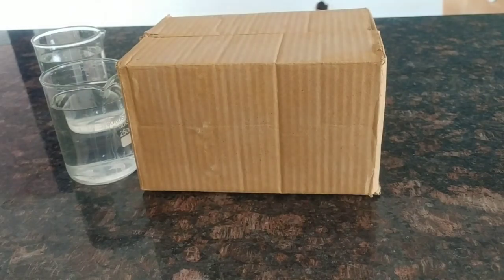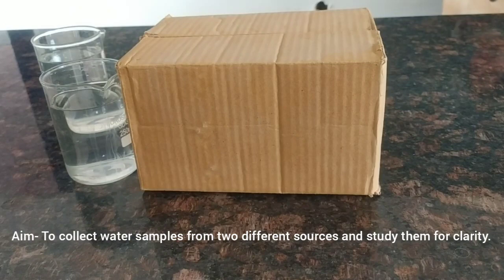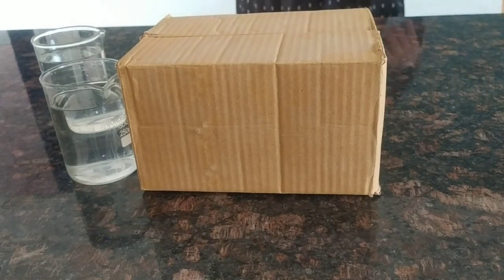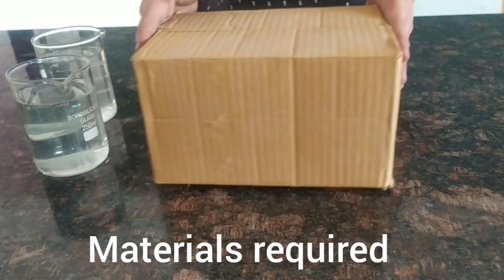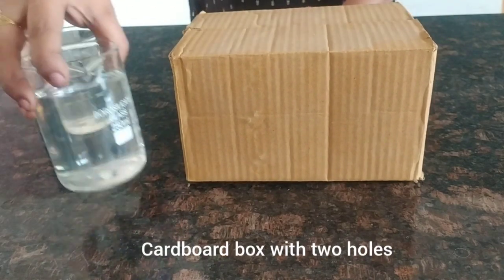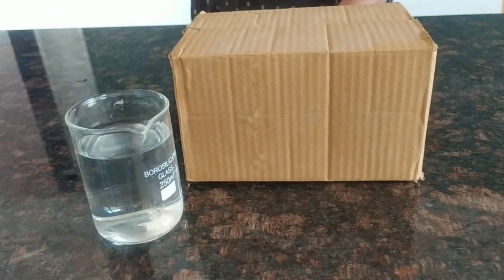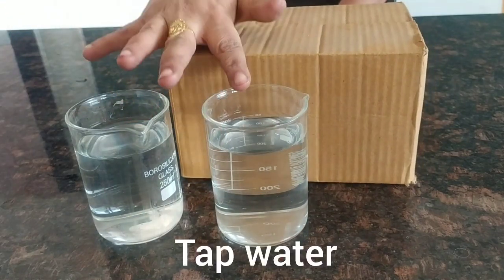Water clarity experiment. Aim: to collect water samples from two different sources and study them for clarity. Materials required: a cardboard box with two holes opposite to each other, river water, and tap water.